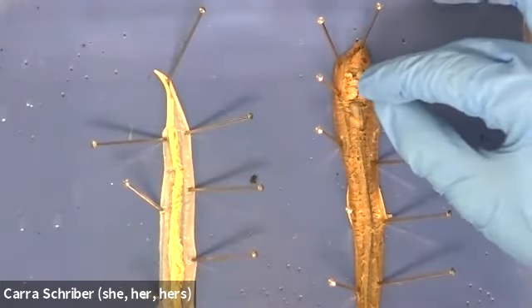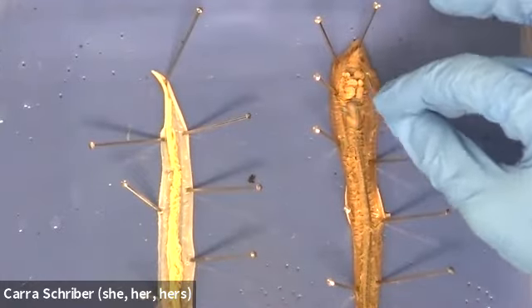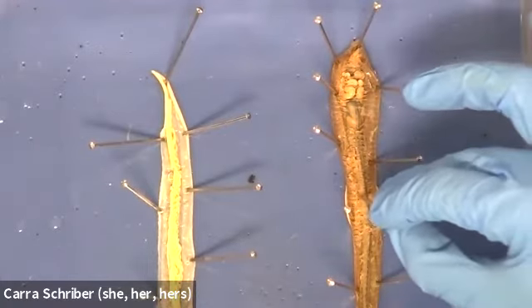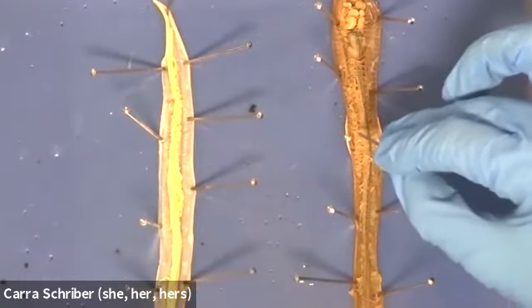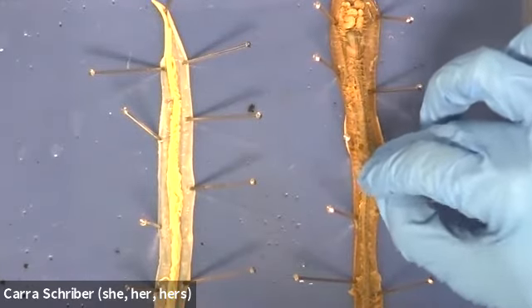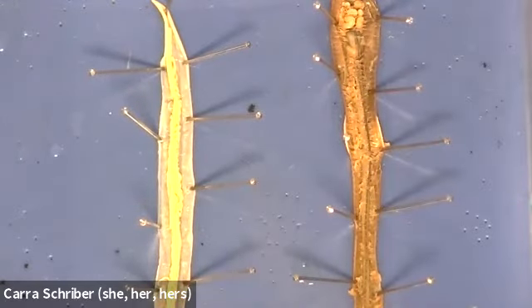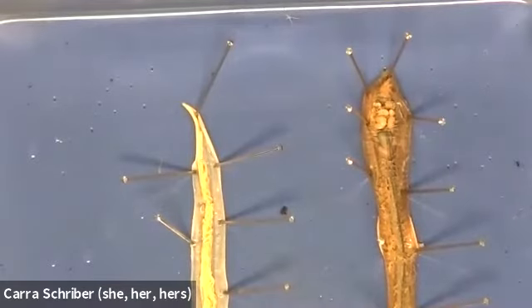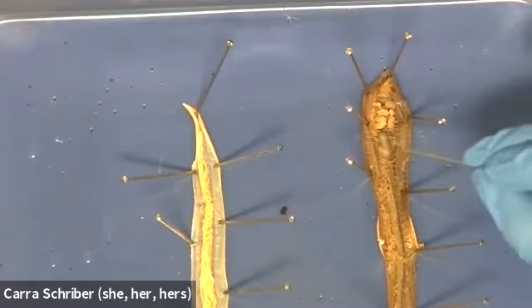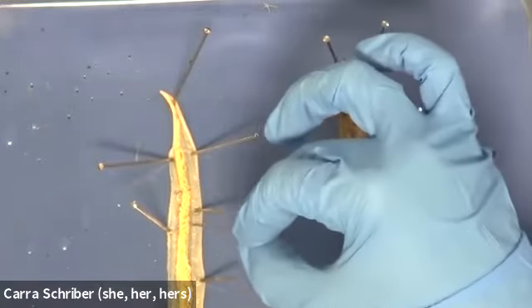organs in place. So let's try to do the same thing with the organs that we did on this other one. I cannot move them because they're connected by this connective tissue here. And we can see this here. Here's a really good spot where there's a lot of connective tissue. So I had to separate that away from the organs because the organs were connected to the ectoderm using that connective tissue. So that's one difference between them. You can also see that complexity-wise, this has a lot of different kinds of forms and organ formation, whereas this has a bunch of squiggly stuff in it.